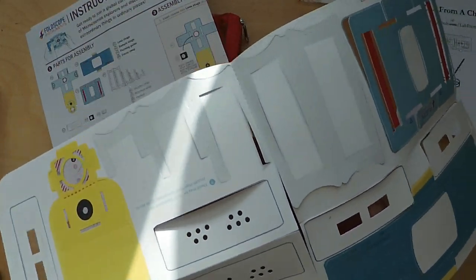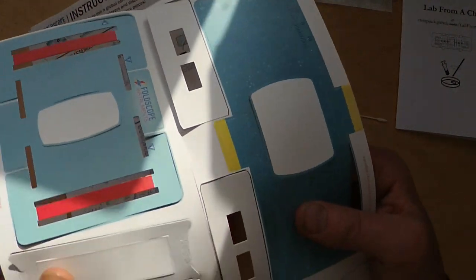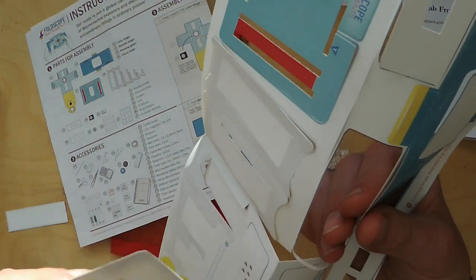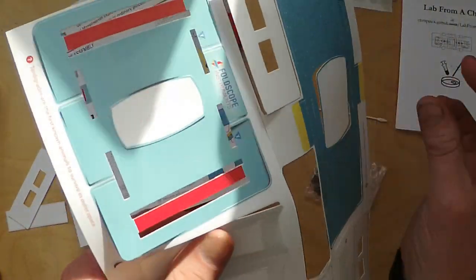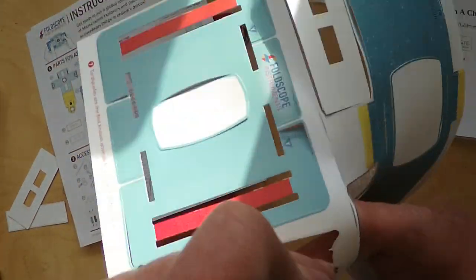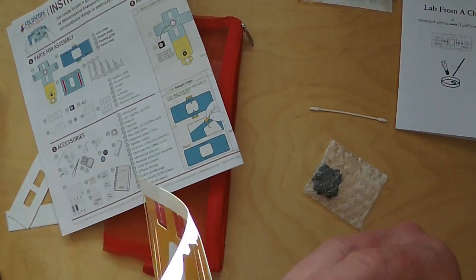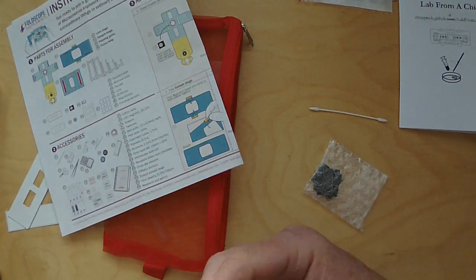This cardboard is very specifically designed - it's really resilient so you can be quite vigorous in the way that you pop out the different components. Don't worry too much, the card can take it. It's really stretchy and it maintains its shape, so don't be too afraid when you're popping all these elements out. For example your lens stage, your focus ramp - just pull that out of the net. Don't be too rough with it and you'll eventually end up with a completed set of components.